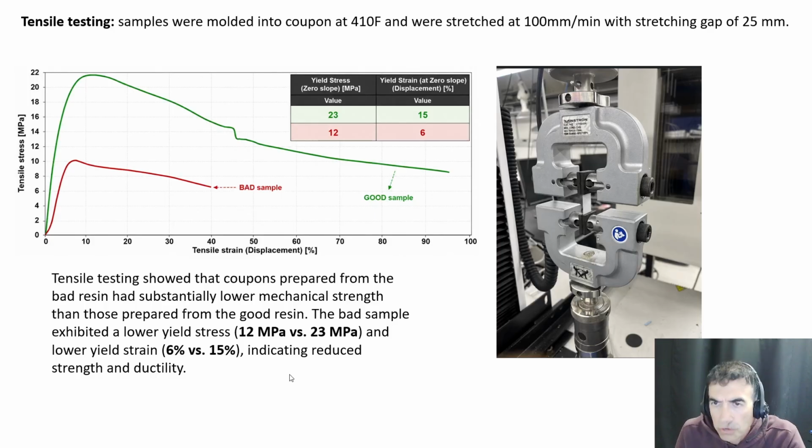Another test that we use to characterize these polymers is mechanical and tensile stress testing. What will happen is that we will compression mold the samples, and we stretch it in a tensile machine, and we'll look at the tensile stress strain curve. As you can see, the good sample has a significantly higher stress strain curve compared to the bad sample in terms of yield stress, yield strain, and elongation.